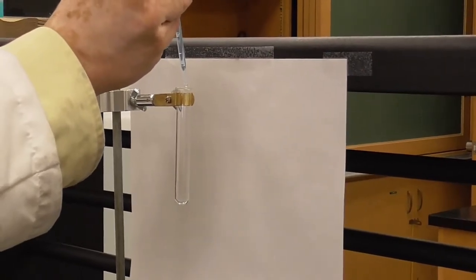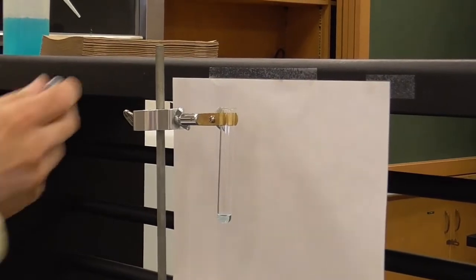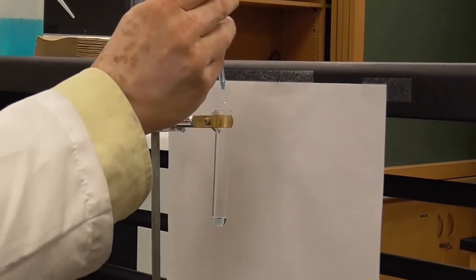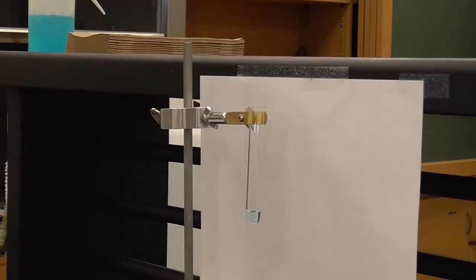1, 2, 3, 4, 5, 6, 7, 8, 9, 10. And some more, 1, 2, 3, 4, 6, 7, 8, 9, 10. Okay.